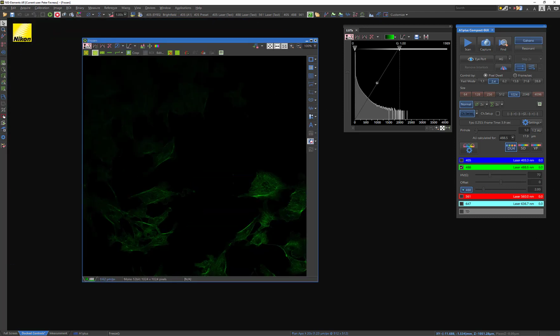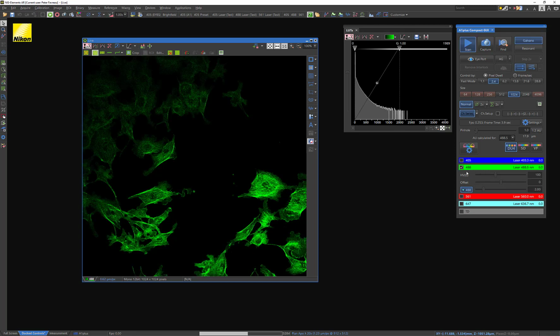But let's say that you had a couple of really bright pixels, and maybe your sample is incredibly bright, and you're still trying to figure out what exactly you want. So I'm just going to bump up that gain again. And hopefully what you see on here is that my LUT is very high. It's kind of reached 4096, which is the highest detectable level, and it's starting to pile up here. And that's because there are pixels that are saturated. And I can know that for sure by selecting this pixel saturation indication button.